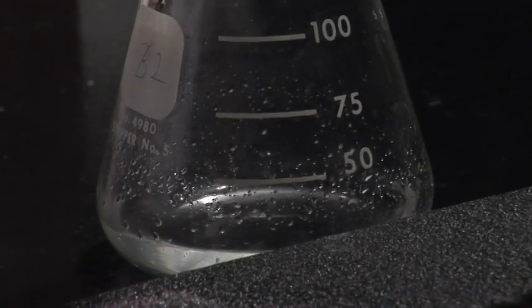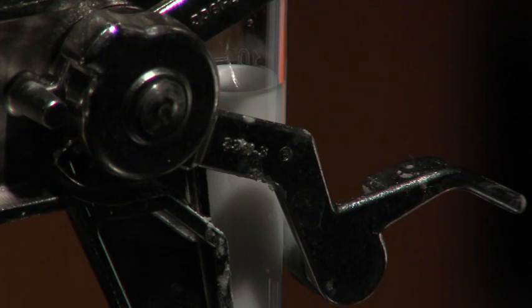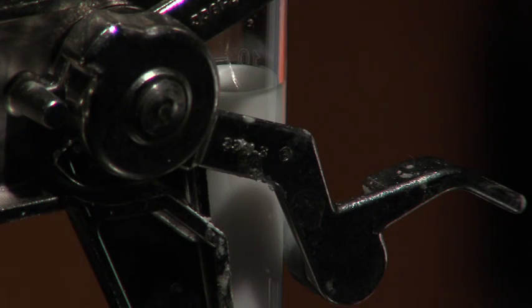Place an empty beaker under the column and release the cap so that the fluid can run out and the cellulose is packed to the bottom.